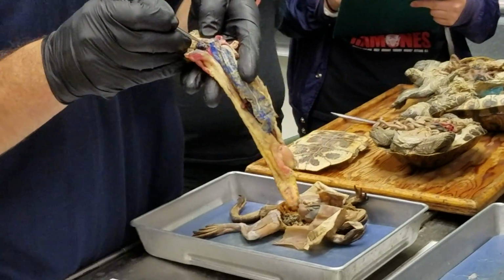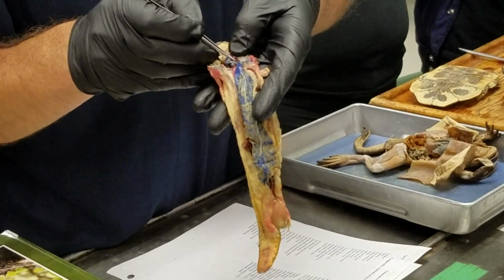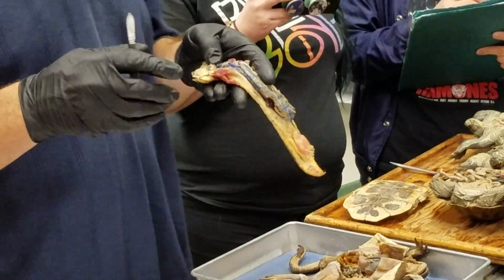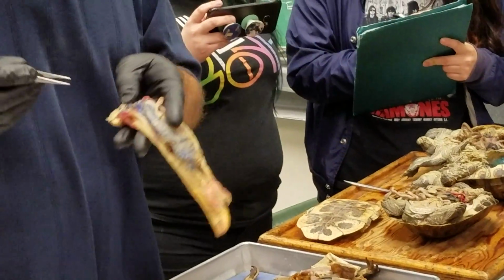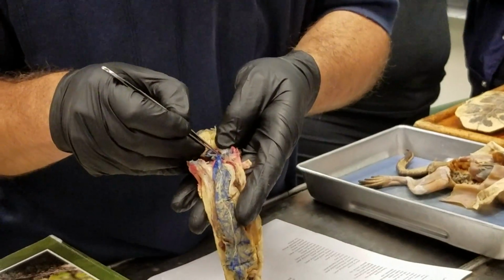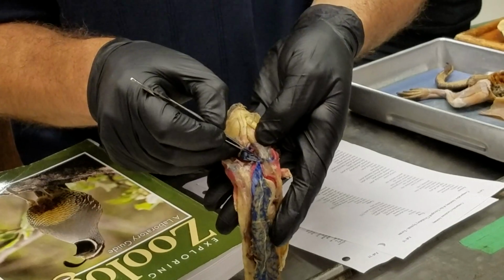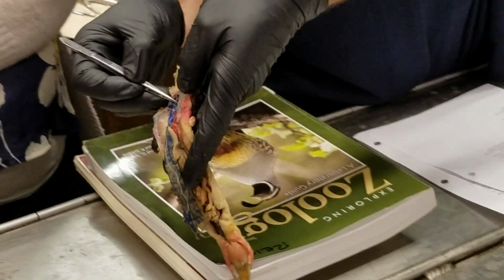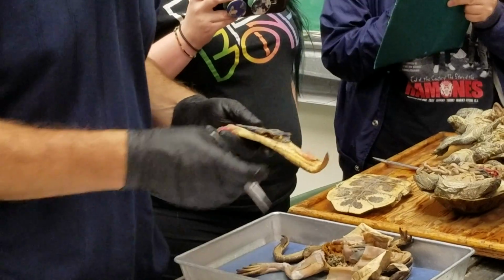So I know this is a little unsatisfying. And that one comes together with the hepatic sinus and then becomes sinus venosus. Exactly. Did everyone hear that? So hepatic sinus and common cardinal joined together form the sinus venosus, or drain into the sinus venosus. So that's the common cardinal that's coming in right there. Okay, from the side. All right.